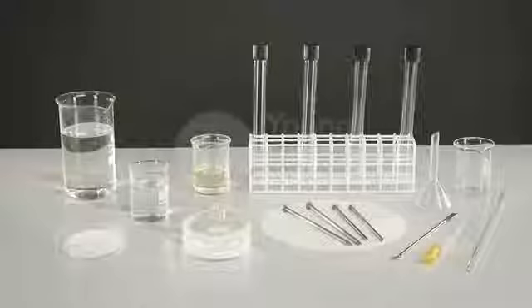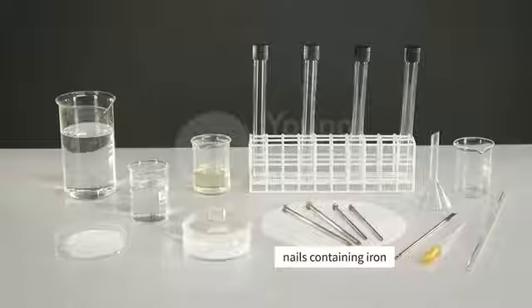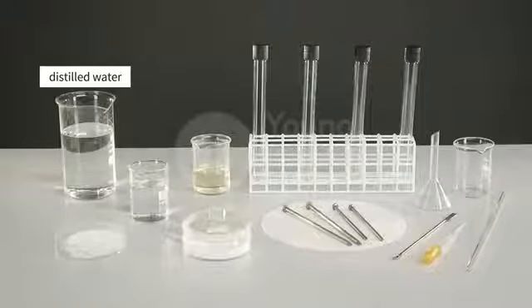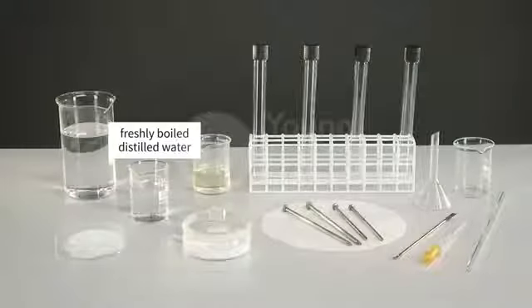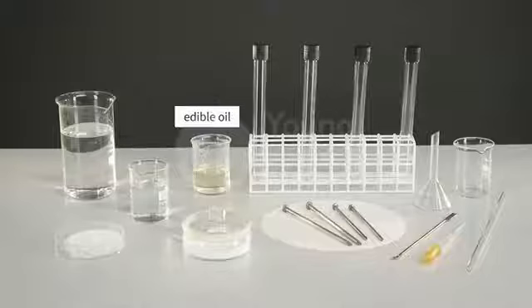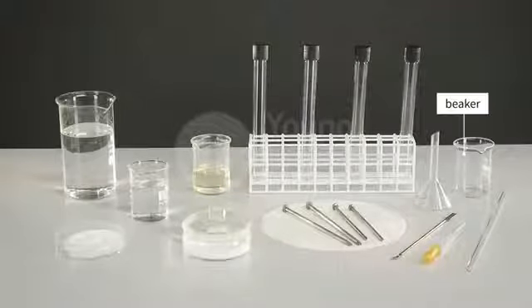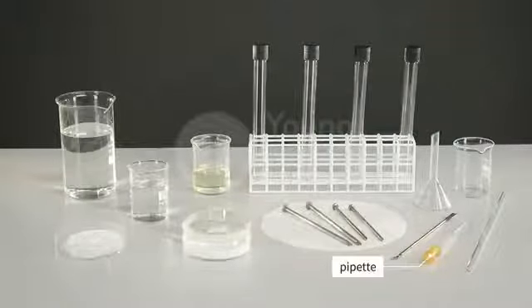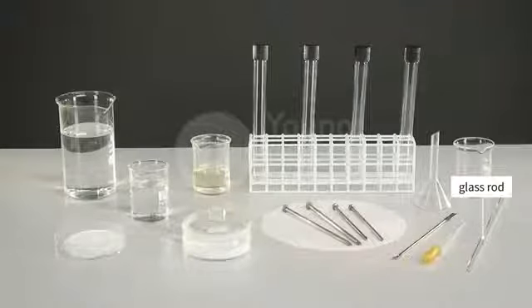Let us investigate the effect of external factors on rusting. We will need the following items for the experiment: nails containing iron, distilled water, sodium chloride, freshly boiled distilled water, edible oil, anhydrous calcium chloride, and test tubes with stoppers, a beaker, a funnel, a pipette, a spatula spoon, and a glass rod.